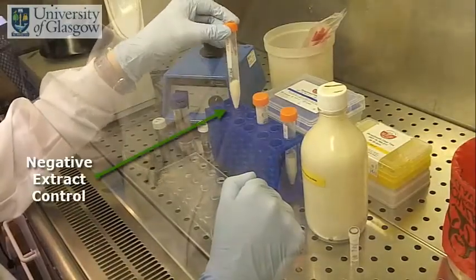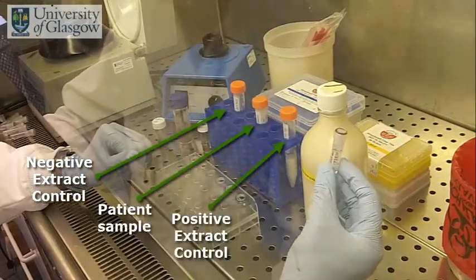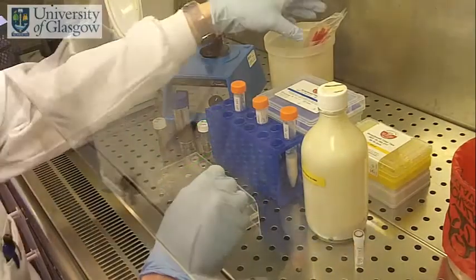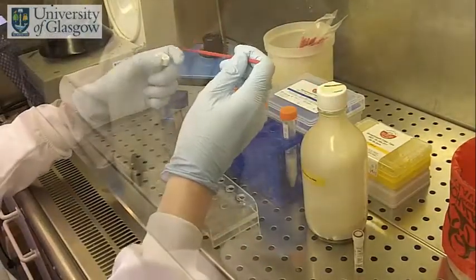So here we have our aliquoted kaolin and DTT mixture, one 15ml tube for each sample. To this kaolin and DTT mixture, we're going to add a pea-sized amount of faeces from each respective sample.